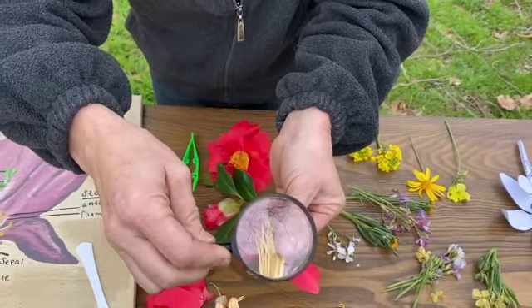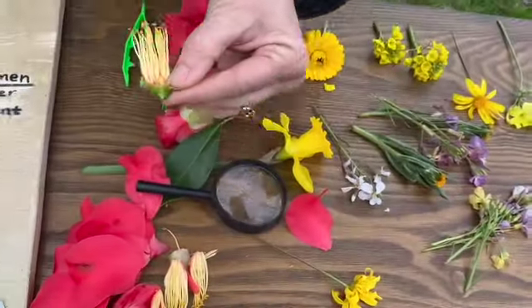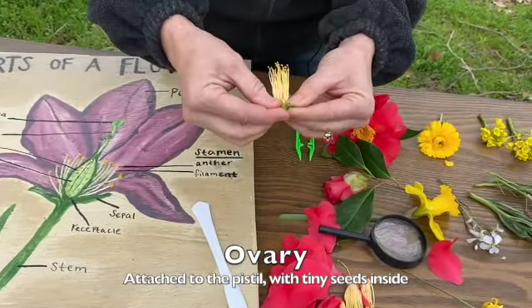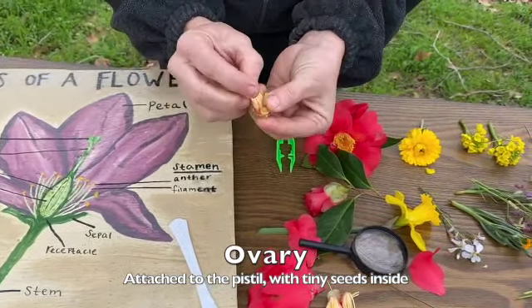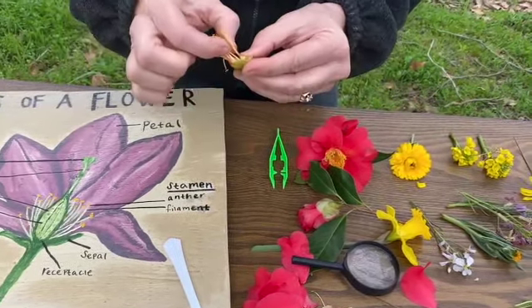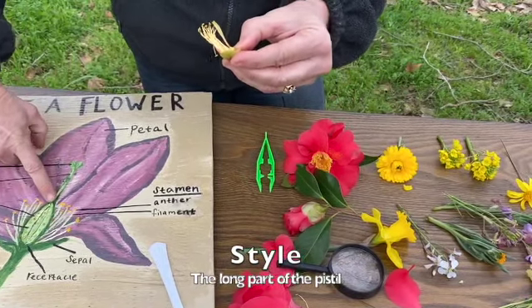Let's see. Look at that big fat part at the bottom. Do you think it matches this area here? So this must be the ovary, and I bet inside there's some little tiny seeds. And we'll take a look at up here. This one's a little different than that, right? It's just got 3 little areas, but it looks like it comes down into one main style.